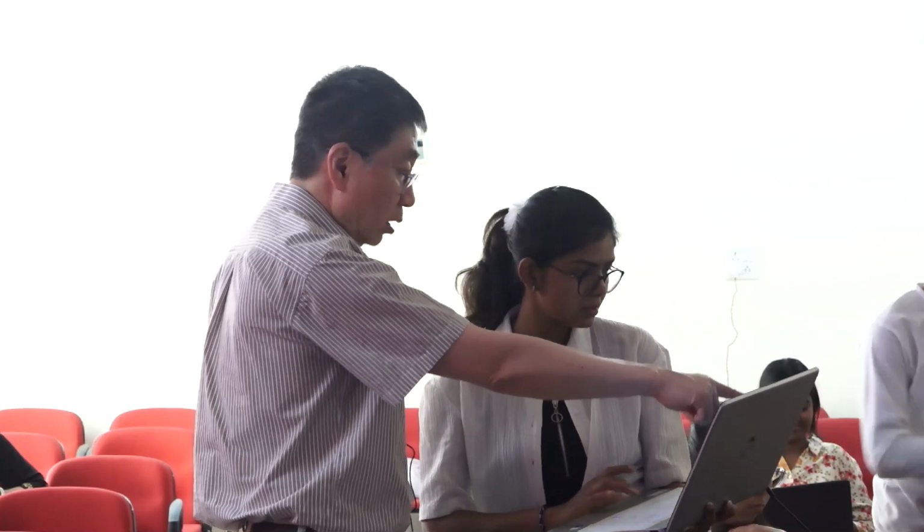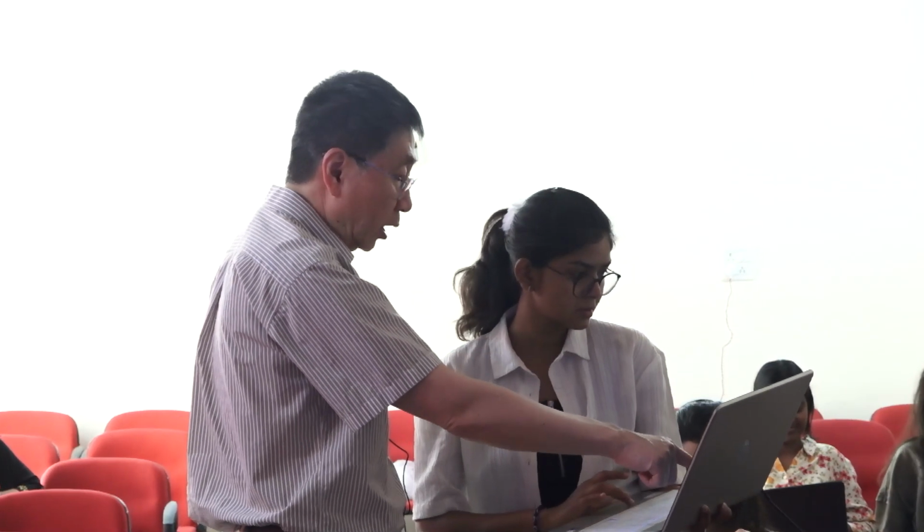And then that's fine. Come here, delete, click on delete residue. That's fine. Don't close it. Delete. Come here, click on... No, the atom, not the water. Click on this carbon. This one is the water. This one, no. Right now you're deleting because you built the extra residue.